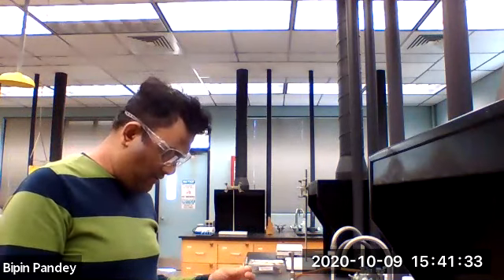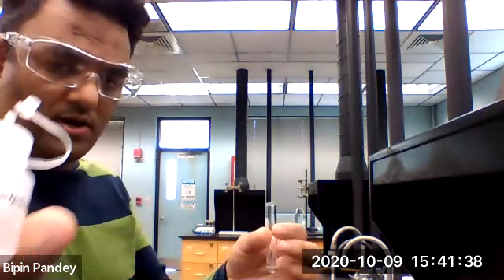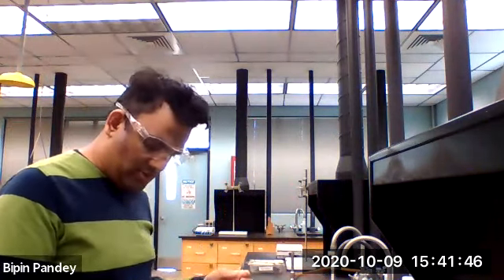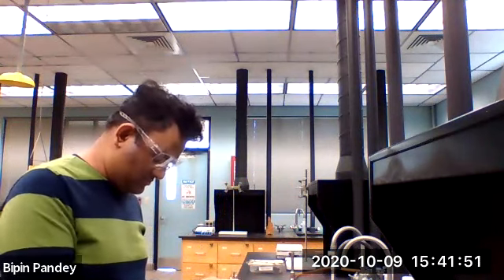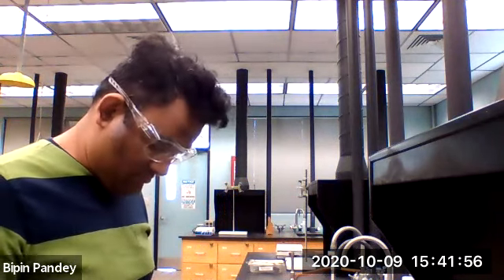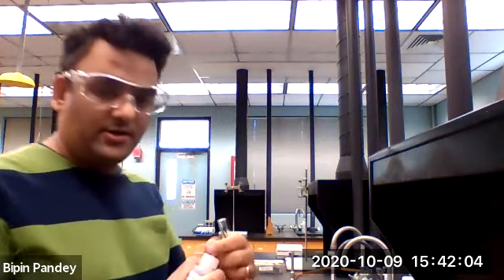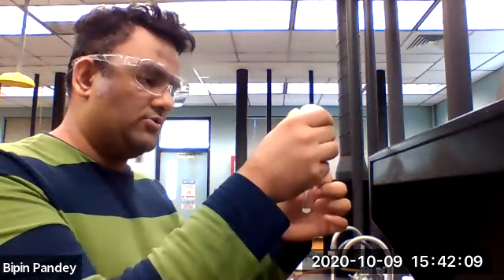I'm going to add 1 drop of phenolphthalein. And I'm going to now take the sodium hydroxide solution and add it and count the drops.